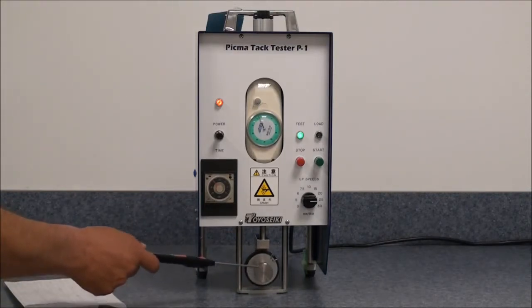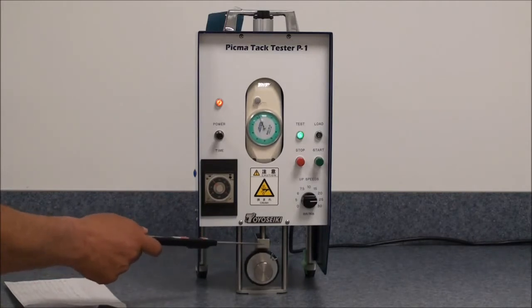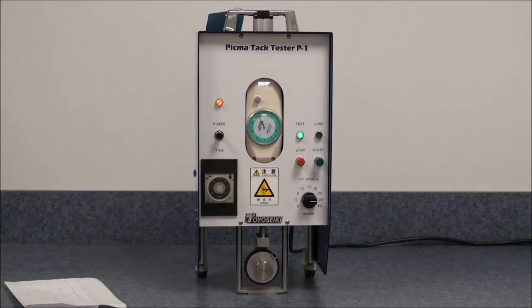The machine will continue to operate until it gets into its upright position.